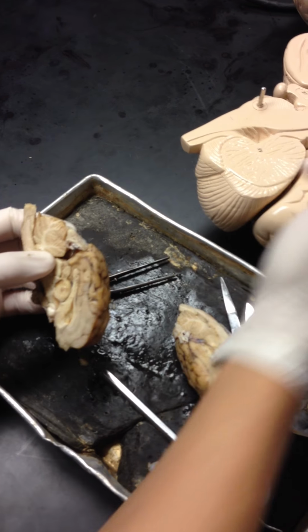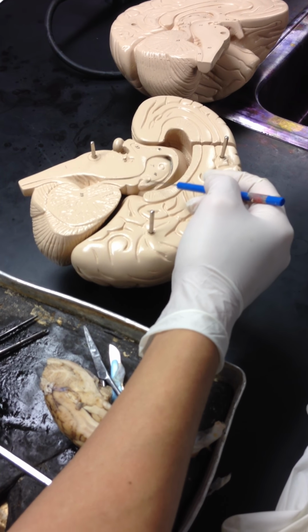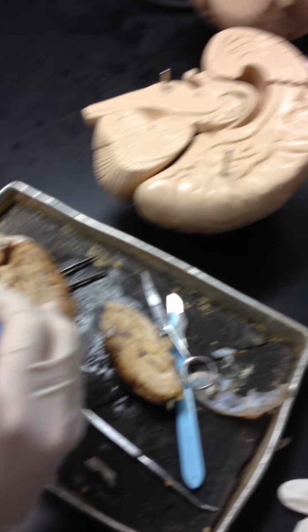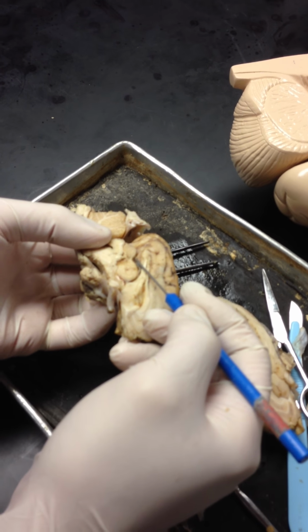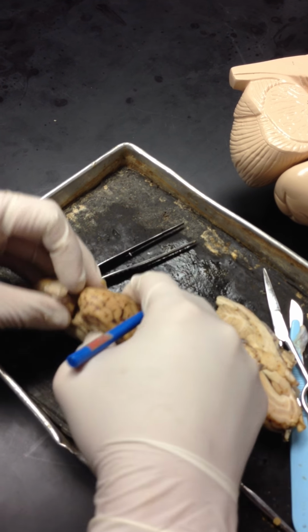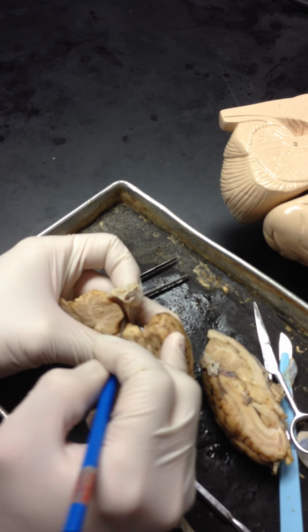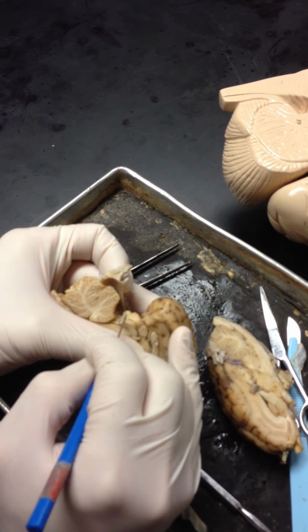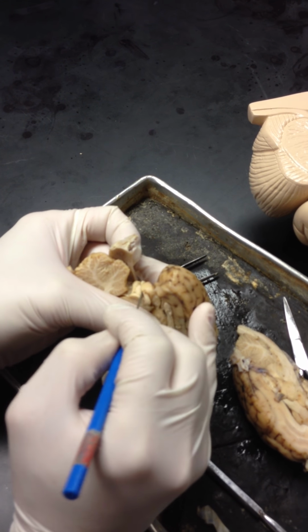Actually, before I go on, in the back, you have what's called an epithalamus, which contains the pineal gland. In the back of this, there's a little mass right here. It's called a pineal gland right here in the back. Okay. Now we're going to move into the back. I'm going to peel this off, and you can actually see the two masses. One on top and one on the bottom. Do you see how I separate the two? The top from the bottom?